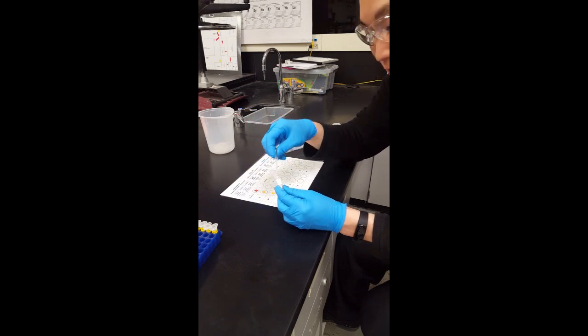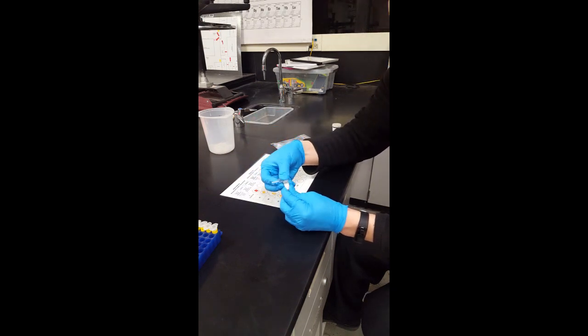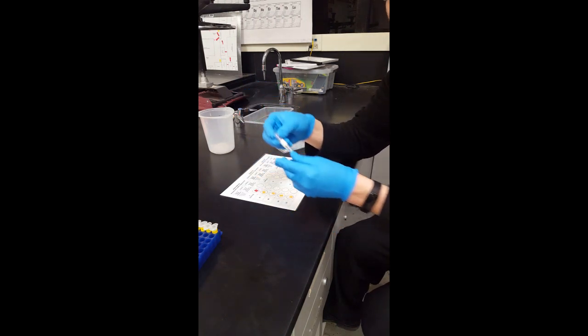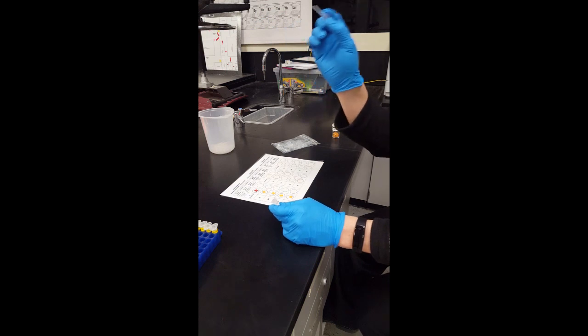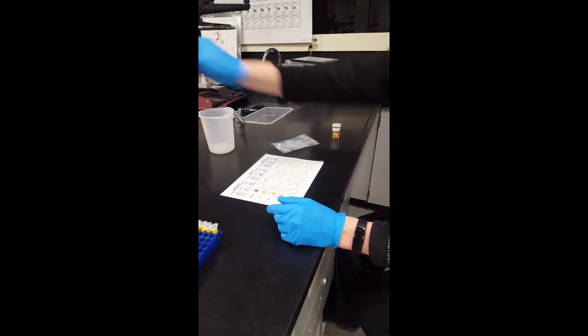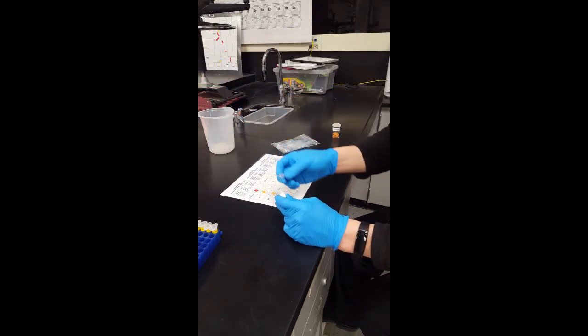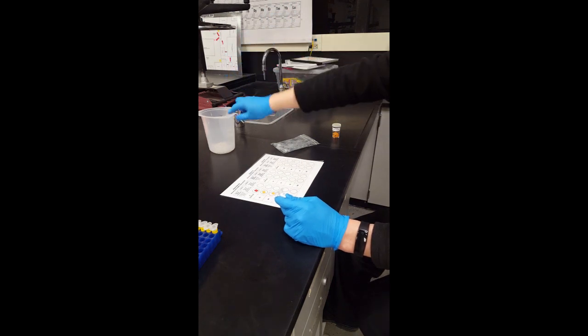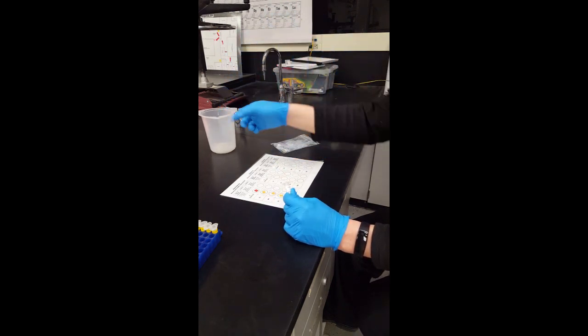If there is any left over, put it back in. If you have people across the table from you that are also working on this, you could also hand this to them. Same transfer pipette. They do their 0. When they are done they can throw it inside the little bin right here.